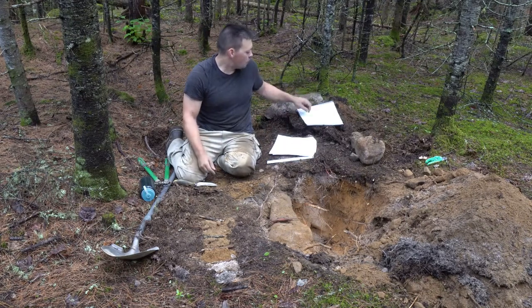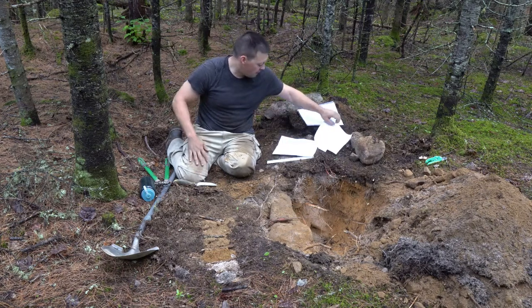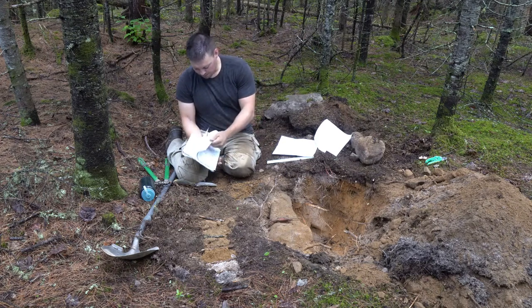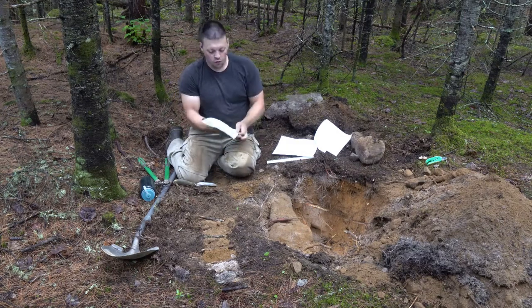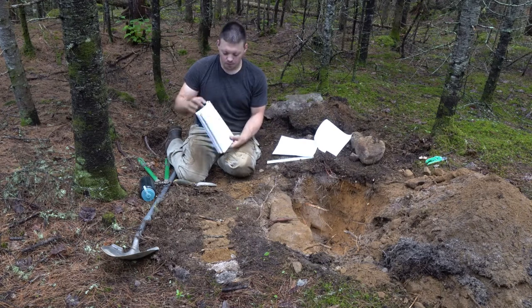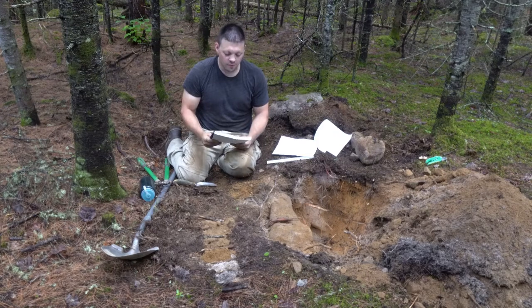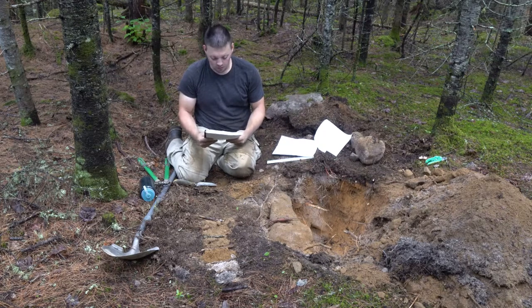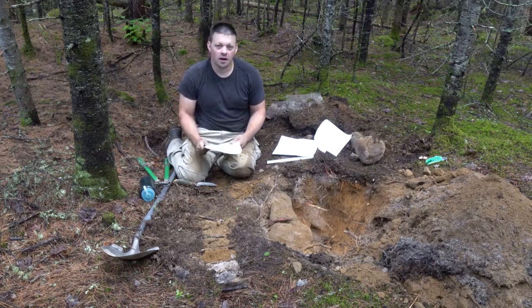Once we have our physical properties determined, we want to identify our soil drainage, which is on page 46, page 1 of the lab report. The drainage key is on page 49, and what we do is we simply follow the key to identify our drainage. Is the forest floor greater or less than 40 centimeters? Our forest floor is only 3 or 4 centimeters, so no. Is it covered with mottles? No. Is it dominantly gray in color?